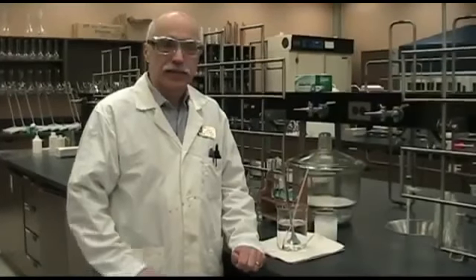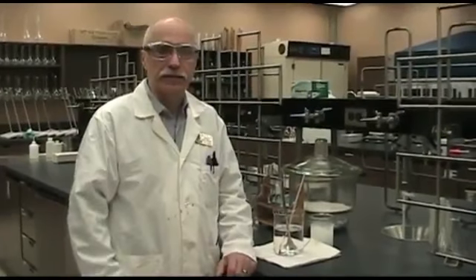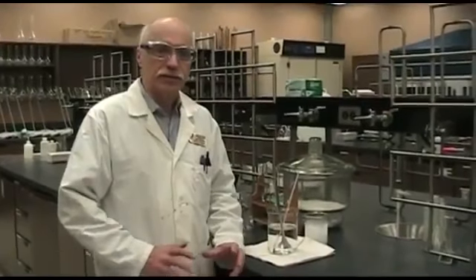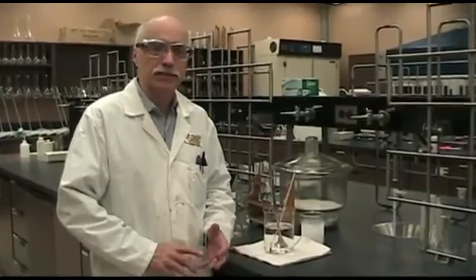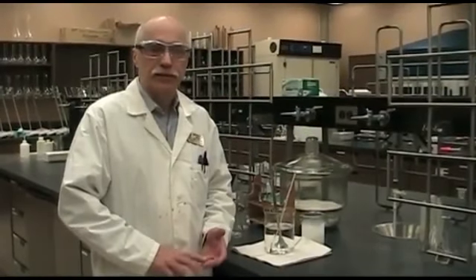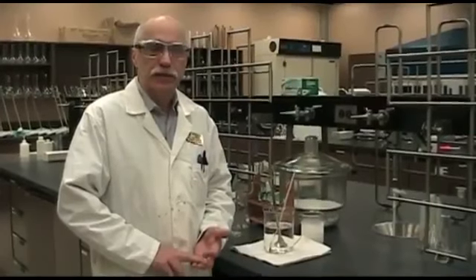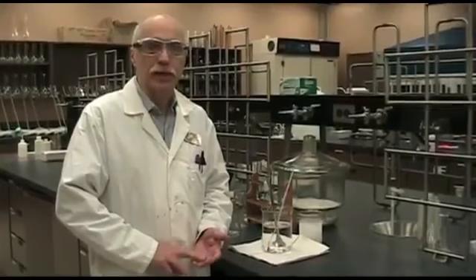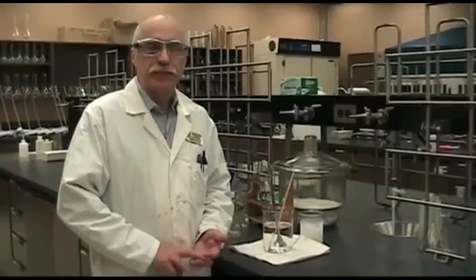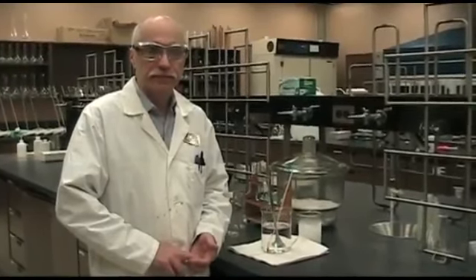This segment is determining the van 't Hoff factor for the freezing point depression. That's the factor for how different solutes dissolve, either molecularly or into ions. We have three substances: sucrose, sodium chloride, and calcium chloride. We're going to determine whether the three change the freezing point, and they're all at 1 molal. That molal is 1 mole of each substance per 1 kilogram of solvent.